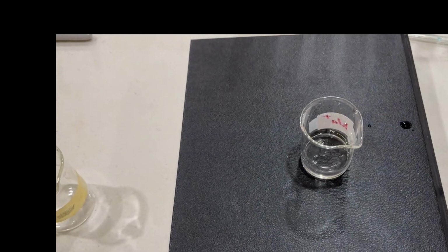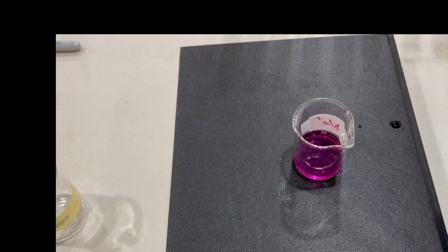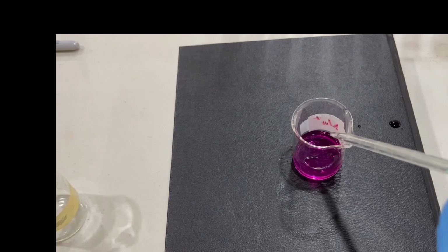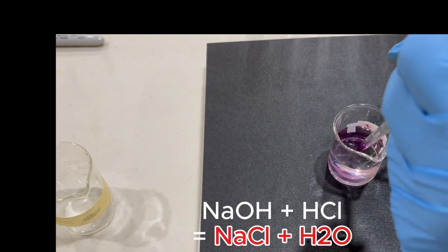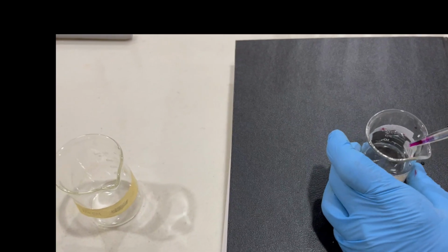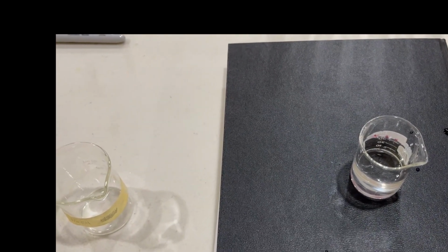Now what we can do here also is put in a drop or so of phenolphthalein inside. So that's phenolphthalein indicator. What we'll do now, drop by drop, is pour some hydrochloric acid into that and see what happens. This acid is very strong. Can you see that now? The phenolphthalein has changed color to colorless. That means we now have an excess of the acid there. Neutralization has happened.